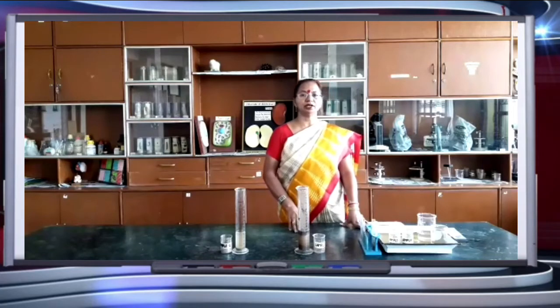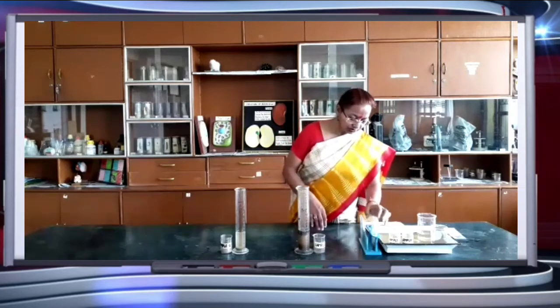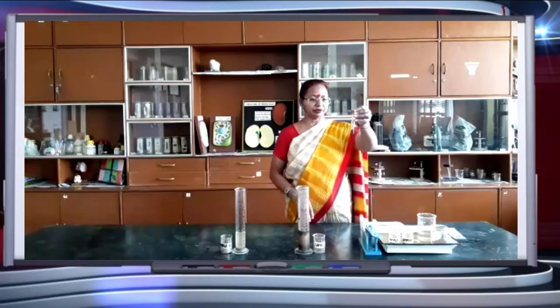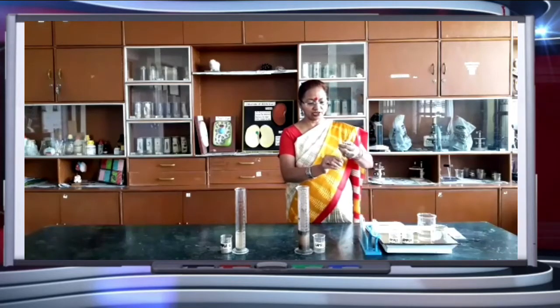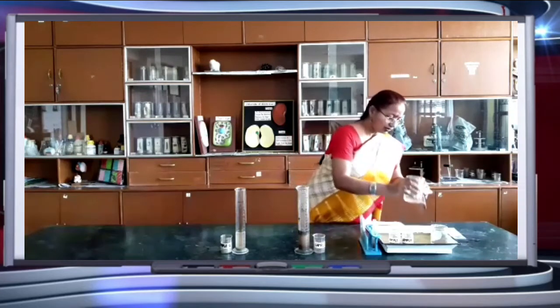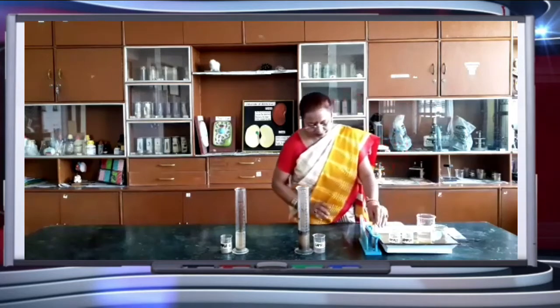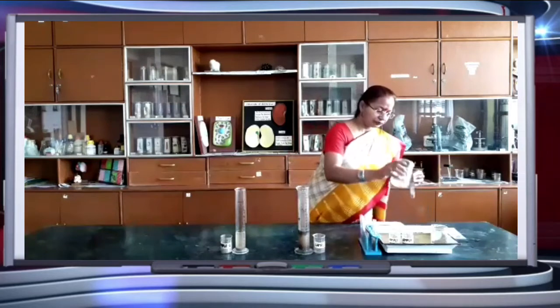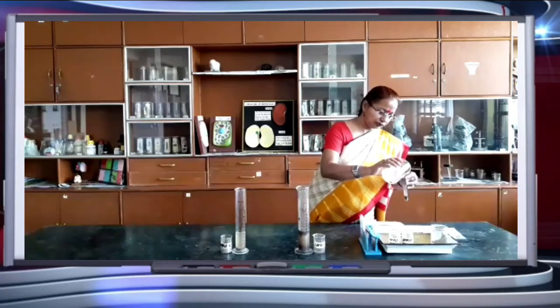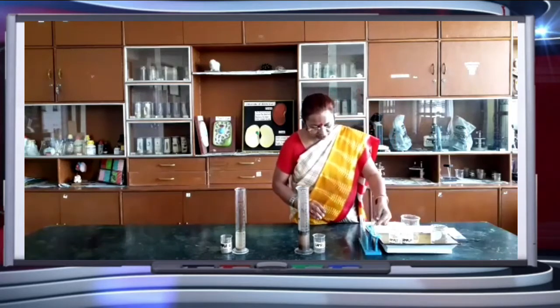Meanwhile, we will check the pH of soil in 3 different samples of soil. Now children, these 3 test tubes, I already prepared with the samples. So this is sample 1, and shake it well because we have to check the pH of soil. Add water and leave it for 1 to 2 minutes. This is sample 2. This also we will check pH with the help of pH paper which we already have with us.